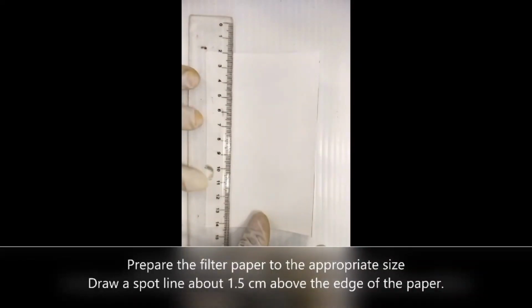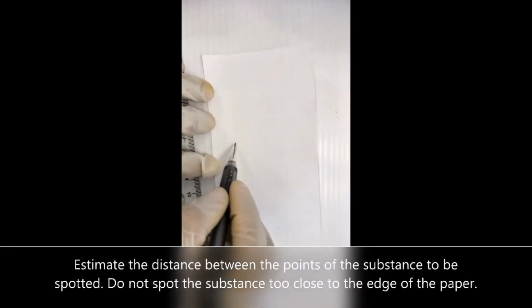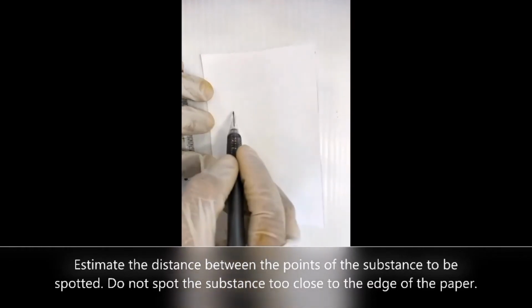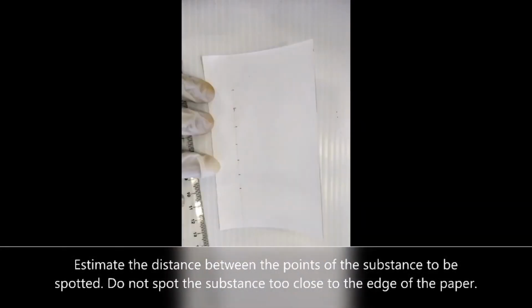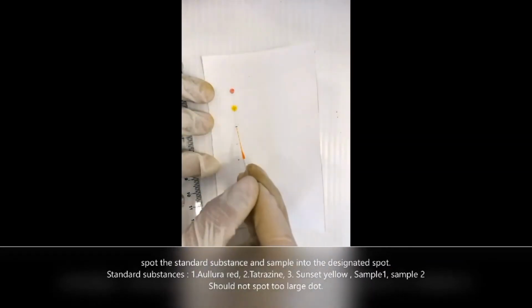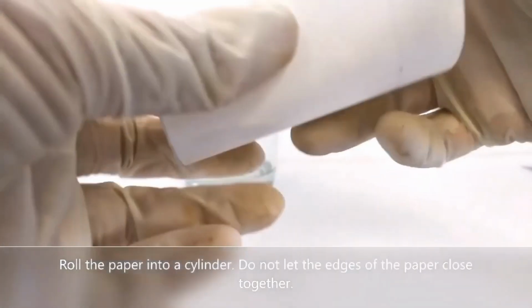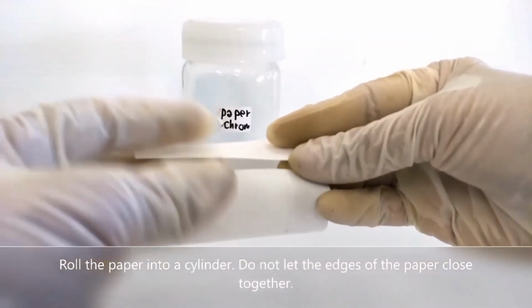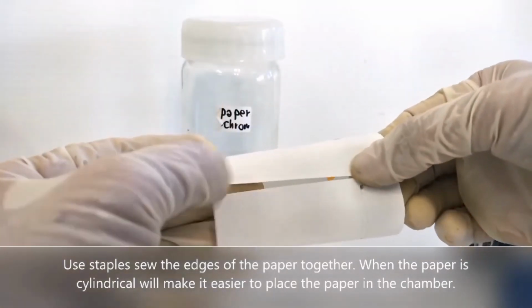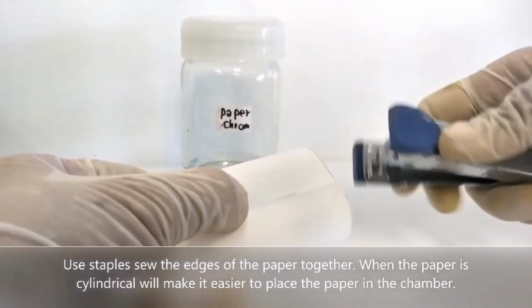The first step is to prepare a filter paper and draw a spot line. Next, estimate the distance between the points of the substance to be spotted, and make sure not to spot the substance too close to the edge of the paper. Next, spot the standard substance and sample into the designated spots. Now, roll the paper into a cylinder and do not let the edges of the paper touch. Do not forget to use staples to keep the edges of the paper together, and it will make it easier to place the paper in the chamber.